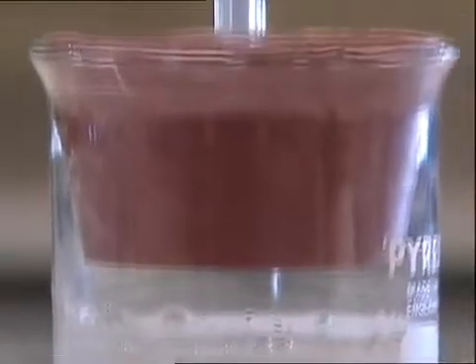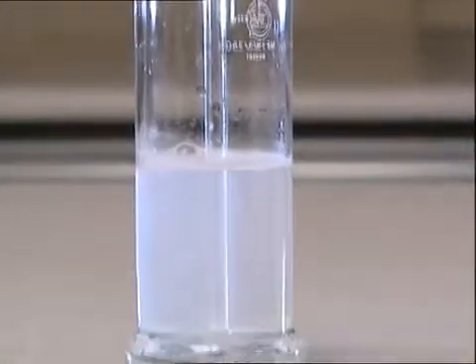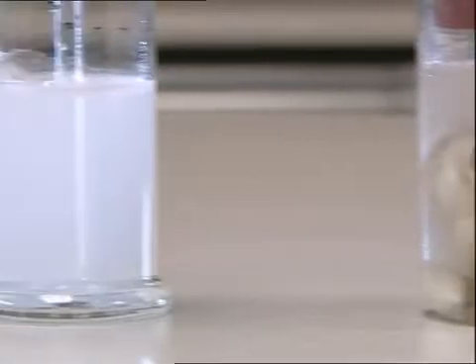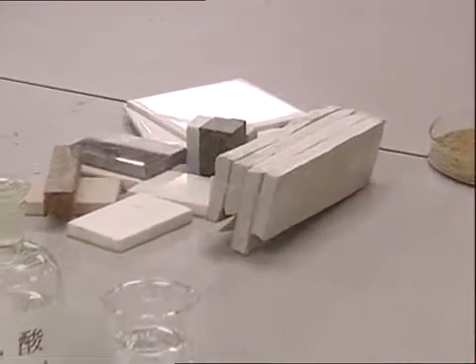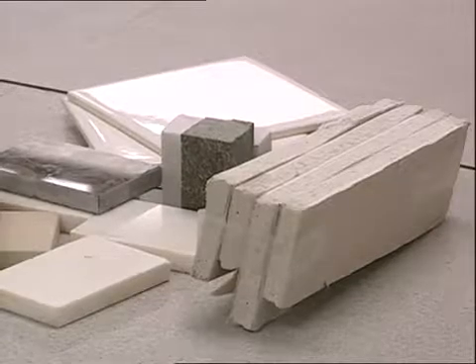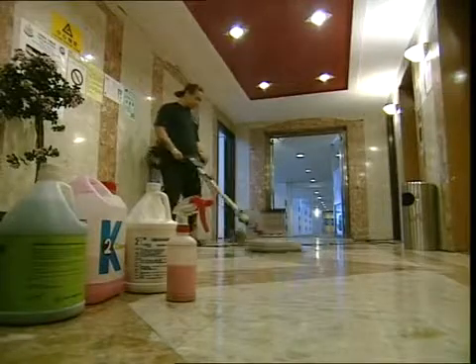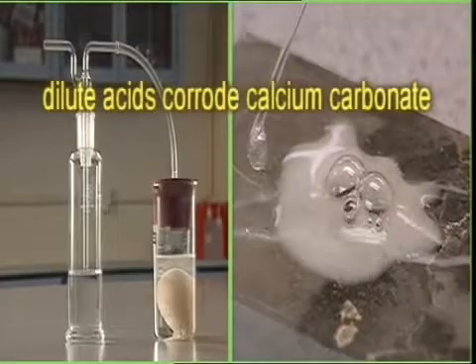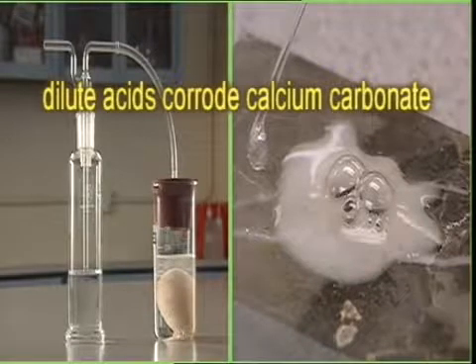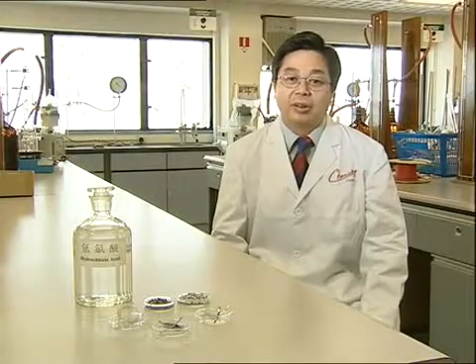The shells of many animals, just like egg shells, are also composed of calcium carbonate. They react with dilute acid in the same manner — the shell surface is corroded away while carbon dioxide is released. Many construction materials, such as marble, limestone and gravel, contain a large amount of calcium carbonate. They can be corroded by dilute acids and release carbon dioxide. That's why cleansers with acid components must not be used to clean marble surfaces. The previous experiment shows us that dilute acids can corrode substances containing calcium carbonate.